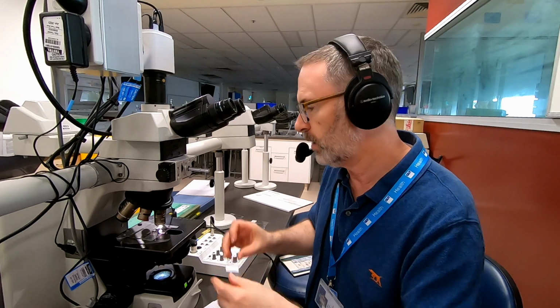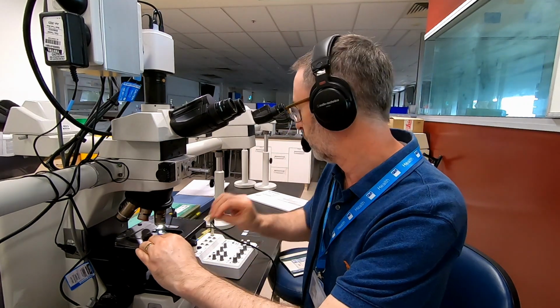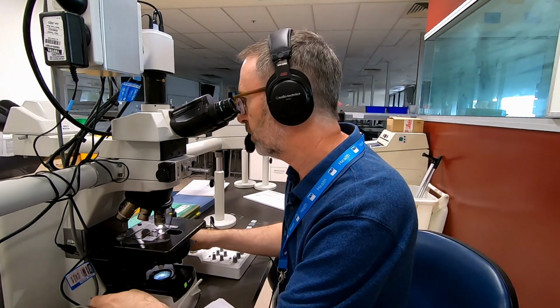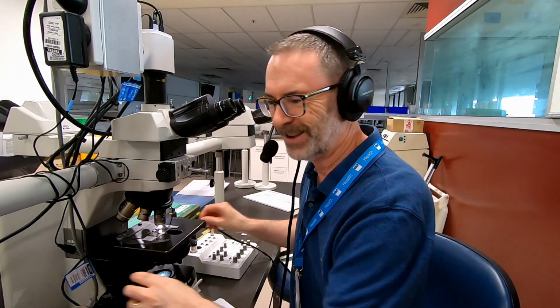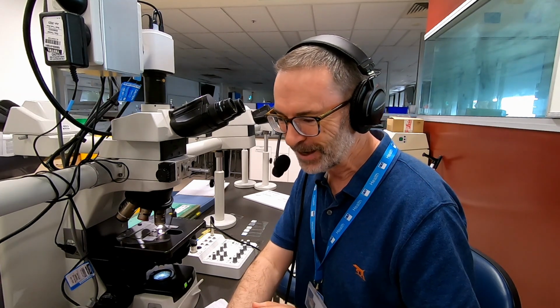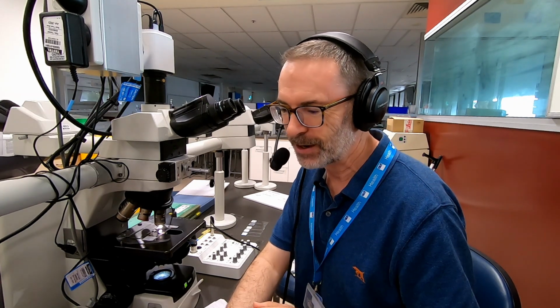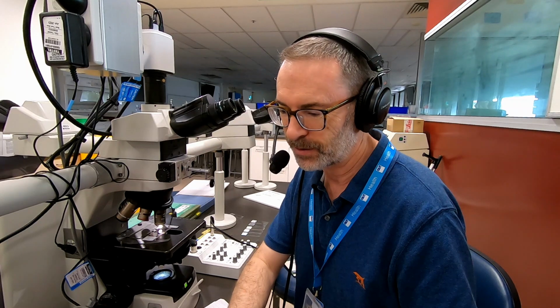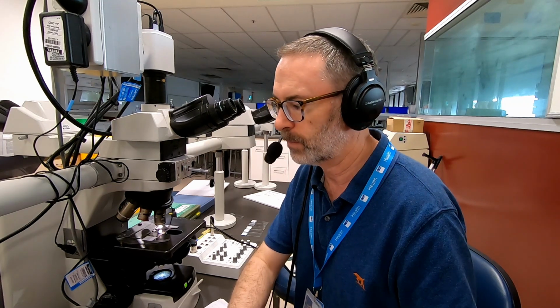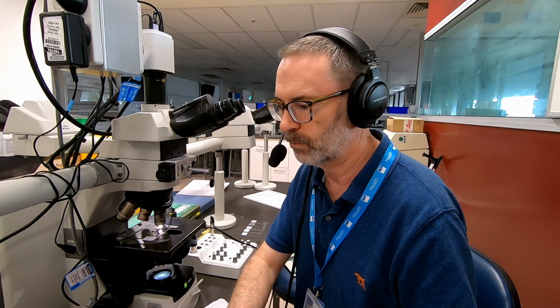So what we have here is, I'll just move over to the microscope by sharing. Well, I won't actually share it through that camera. I've got 2 cameras going here at the moment, making things very complicated. So bear with me while I correct all these things. I'll do that, and then I'll do that, and that'll then bring up the screen. And so I'm recording that as well.